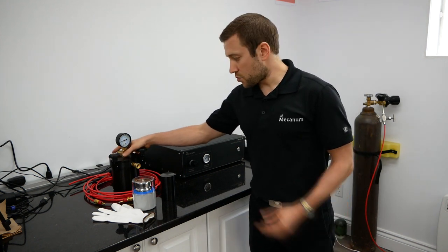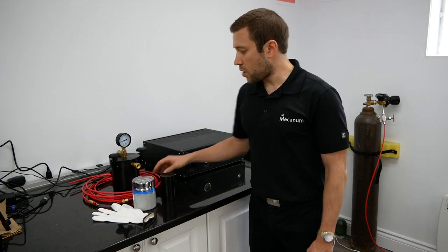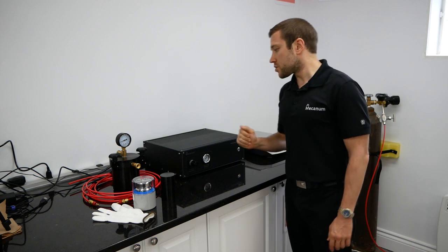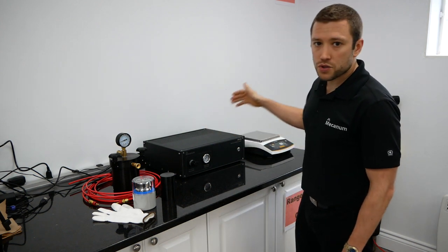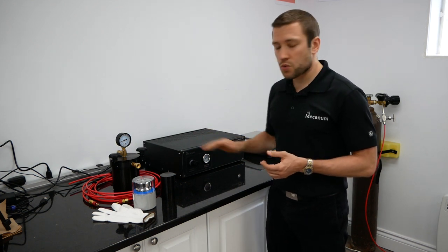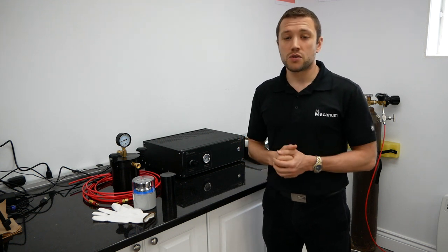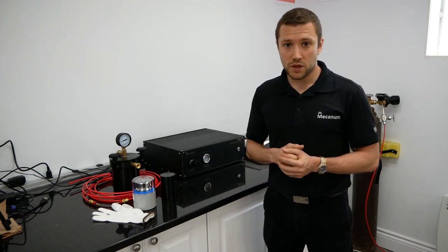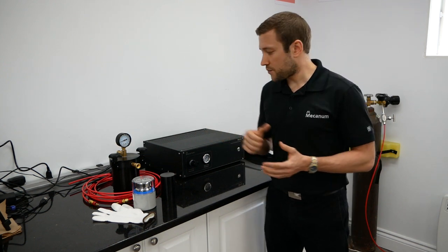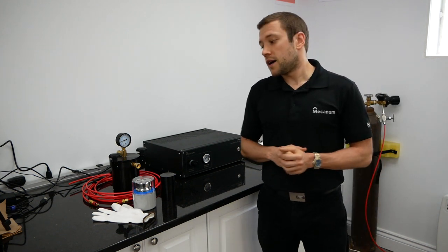the test chamber in which you will install your sample, and two tubes. One to connect the test chamber to the main unit, and another one to connect the main unit to your gas source. So this is very important. The porosity meter works either with argon gas or compressed air, so you will need to equip your lab with one of those two gas sources, and preferably argon gas. So now that you have a very good idea of the test setup, let's make an example.